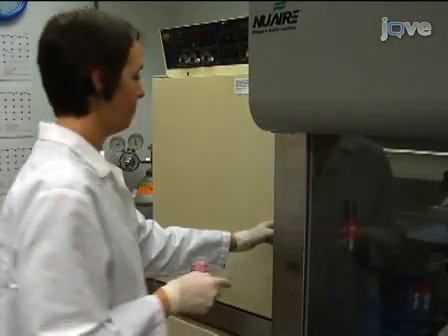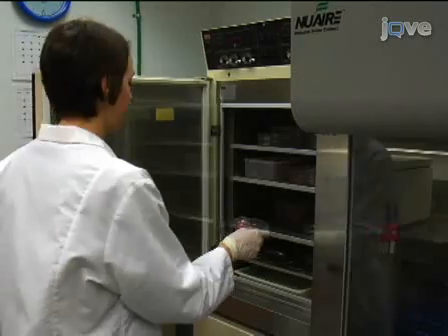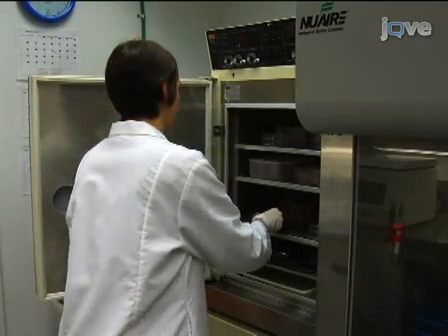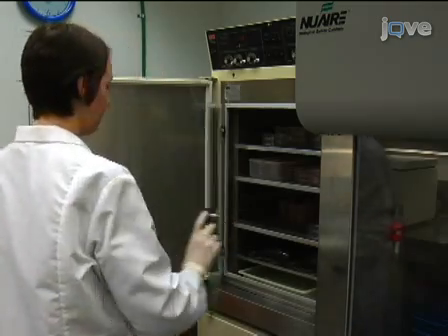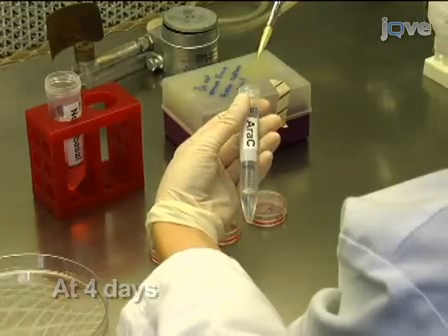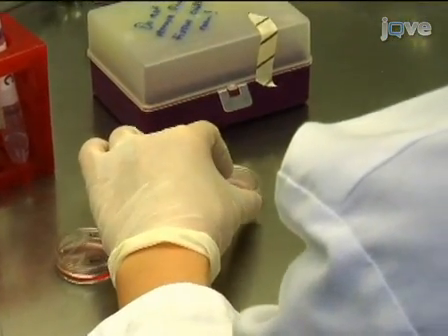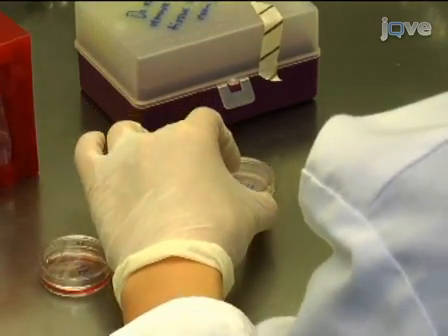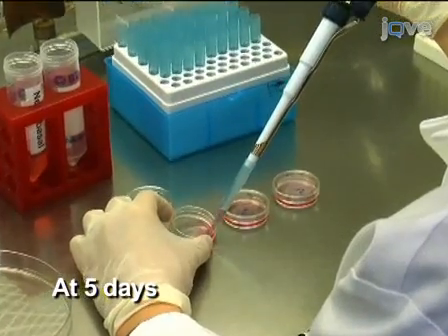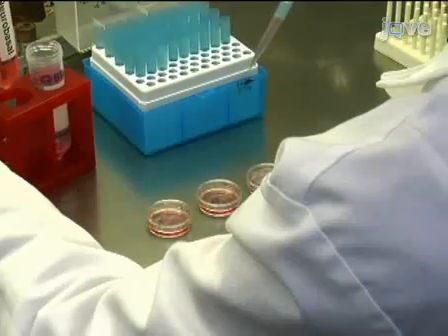Allow the cultures to grow in a culture incubator for 10 to 14 days for synaptic development and maturation. Add the antimitotic Ara-C to arrest glial growth at day in vitro 4. Also, at day in vitro 5, perform a half-medium exchange with neurobasal medium plus B27 supplement to enhance neuronal survival.